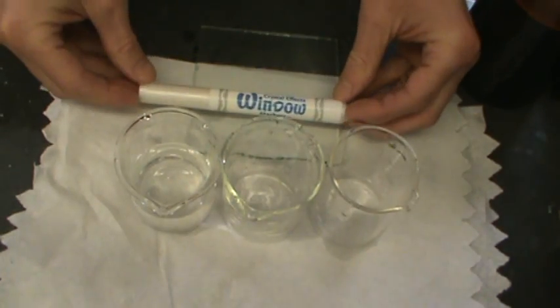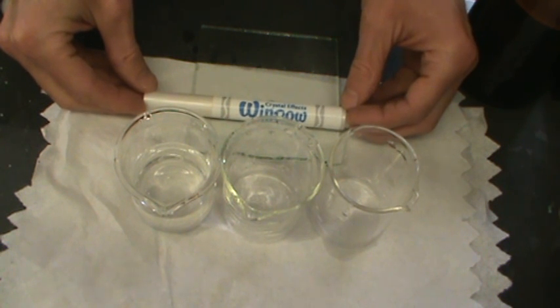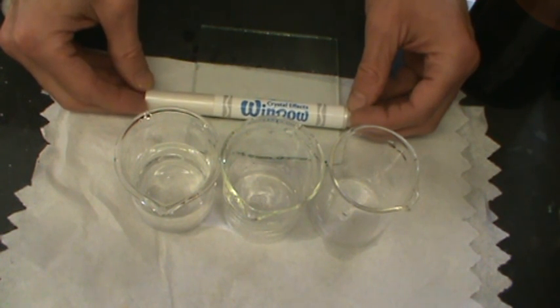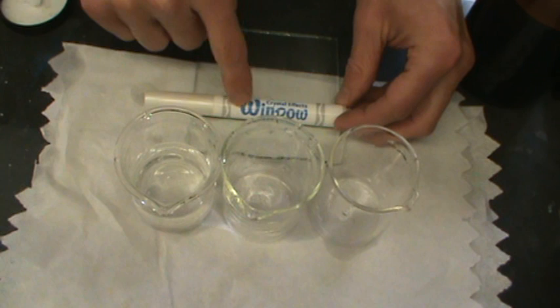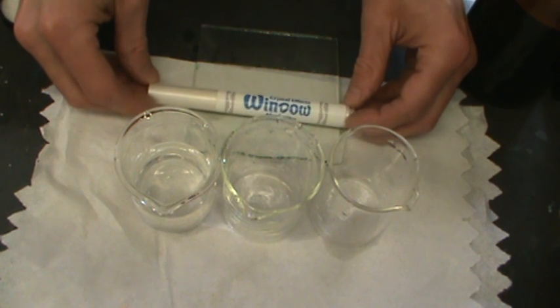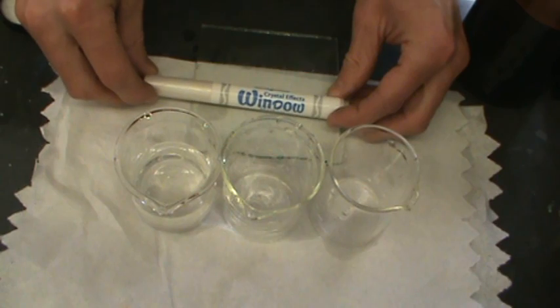We think these crystal markers contain a super-saturated solution of sodium acetate. Now, sodium acetate is a weak base. So we think that if we test and see if the residue formed by these markers contains a weak base, that's some evidence that our idea is correct—that these do contain the weak base sodium acetate.